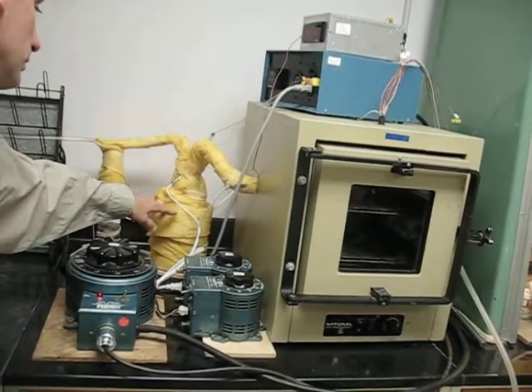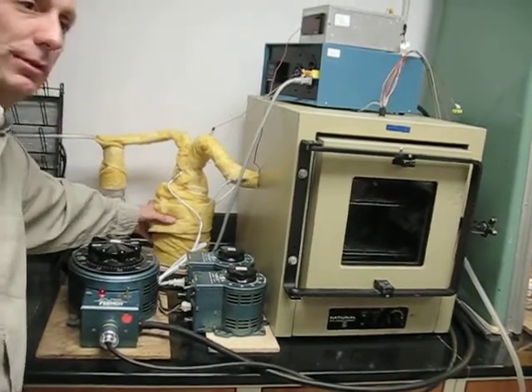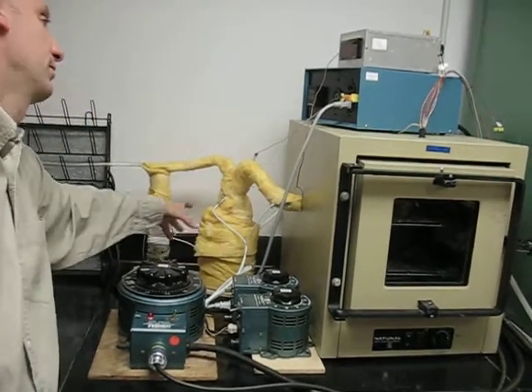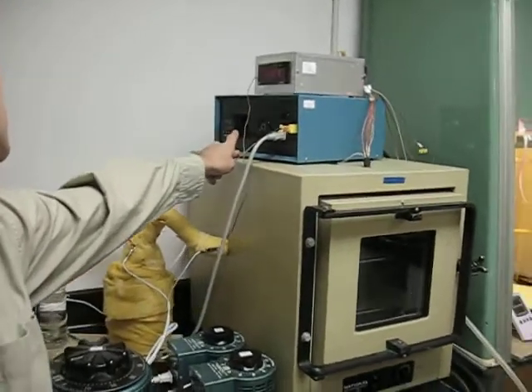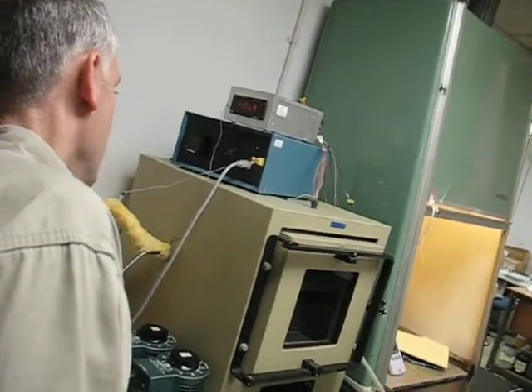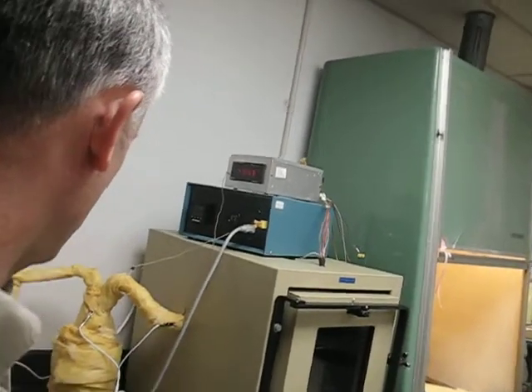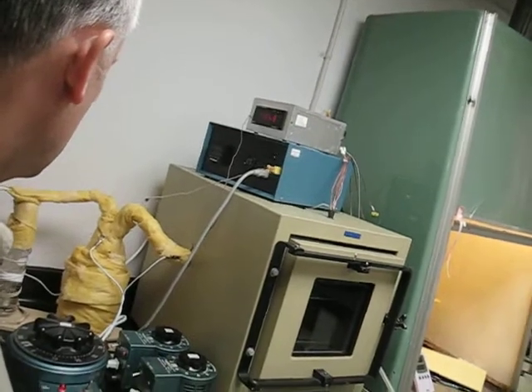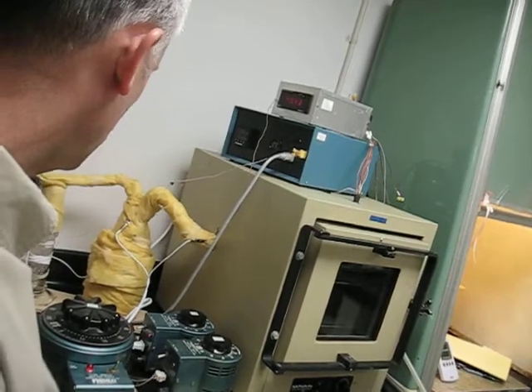More critical to temperature control, or more difficult to control as a parameter, is the humidity. So we do have a temperature feedback control device for the temperature of the final humidifier, which we use a set point of 36 degrees C, so that we produce a dew point of 36 degrees C, which again we monitor.